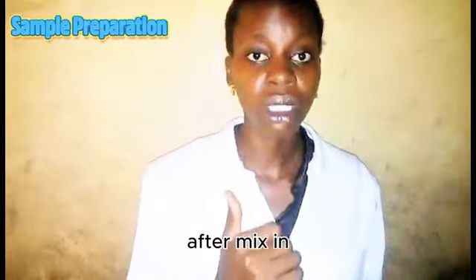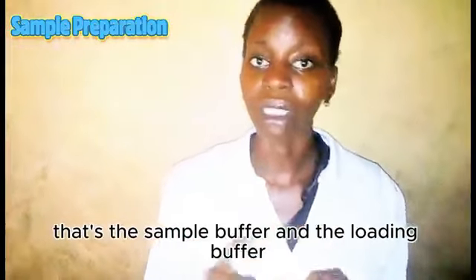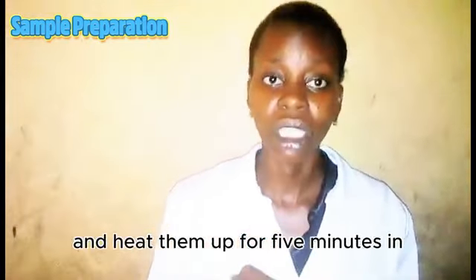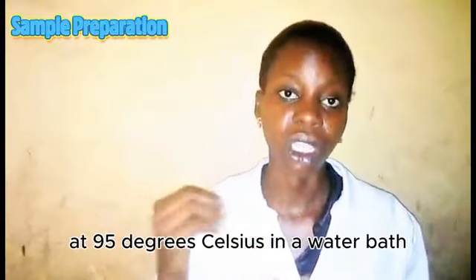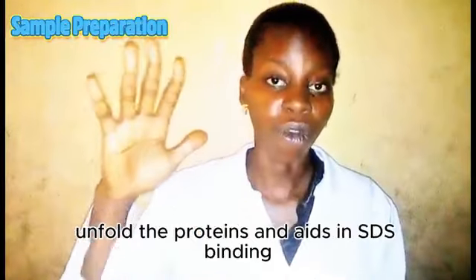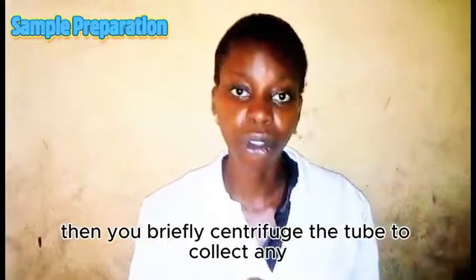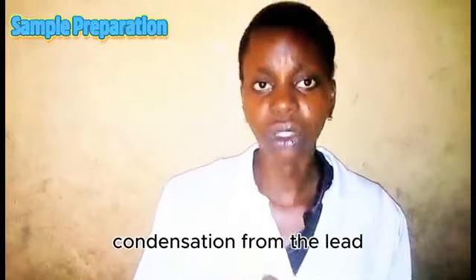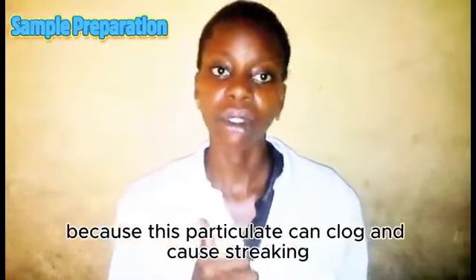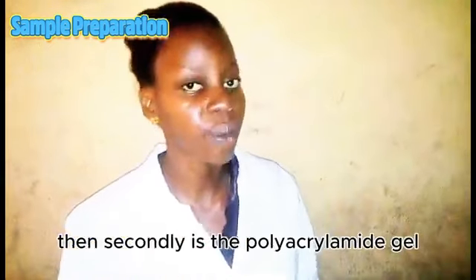After mixing the above mentioned samples, that's the sample buffer and the loading buffer, you add them to the protein samples and heat them up for 5 minutes at 95 degrees Celsius in a water bath. The essence of this heating process is to help completely unfold the proteins and aid SDS binding. Then you briefly centrifuge the tube to collect any condensation from the lid and pellet any insoluble particulate matter, because this particulate can clog and cause streaking. Then secondly is the polyacrylamide gel.